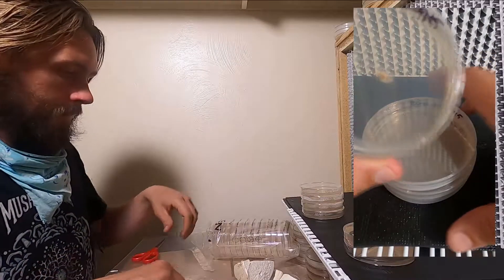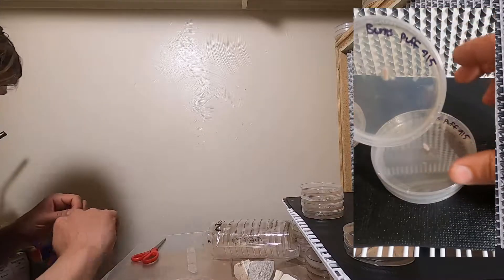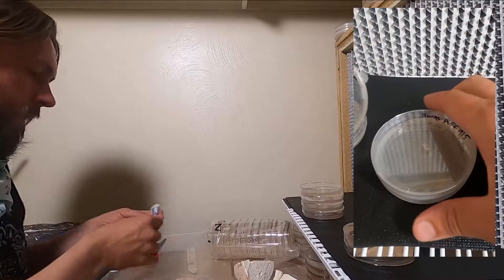And a few days later, three days later, you can see that they're starting to create some mycelium around the edges and they came out clean. All four of those plates.